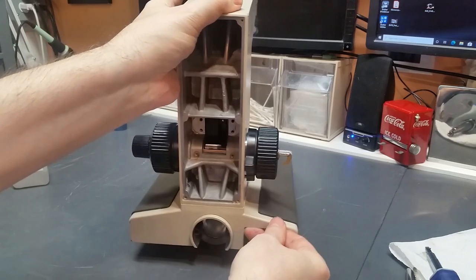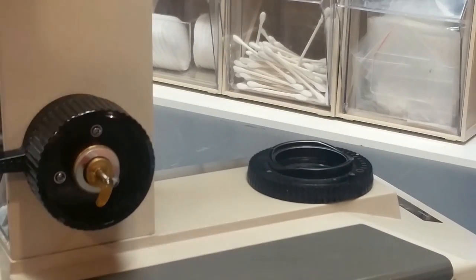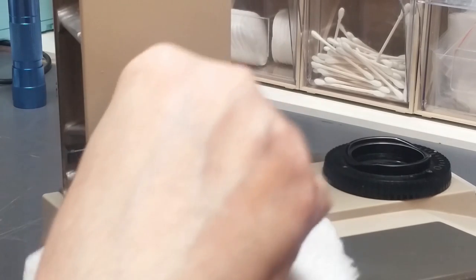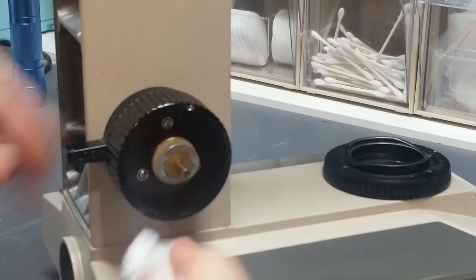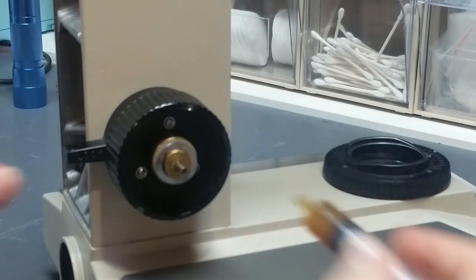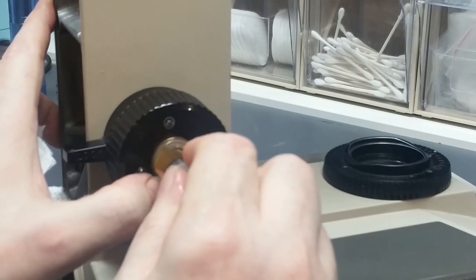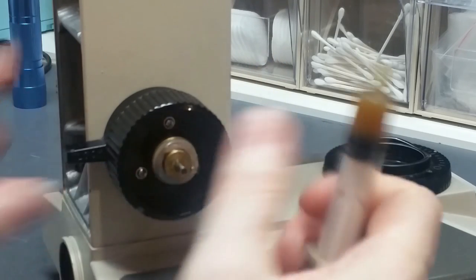And then we've got to go on the other side and clean up the grease that was pushed out. And you can see there was grease pushed out. And it always is. If there's not, you probably didn't do it right. Okay, since I wiped off some of the grease on this just now, I'm going to apply a little bit more grease to that. All right.